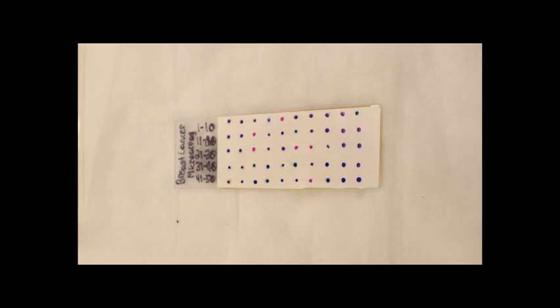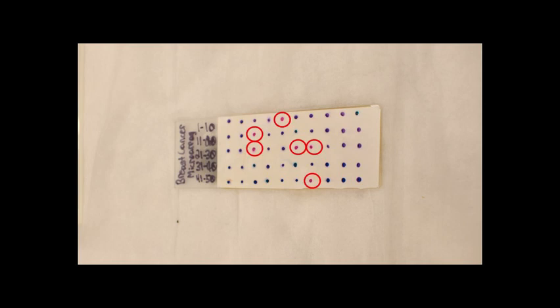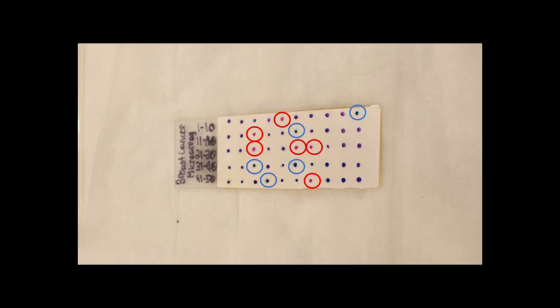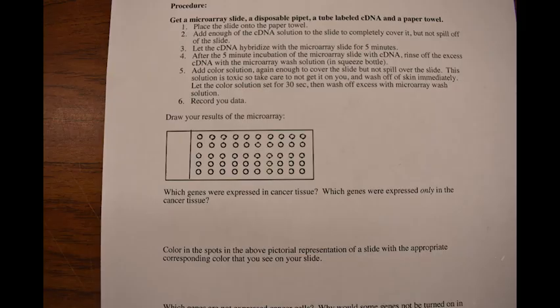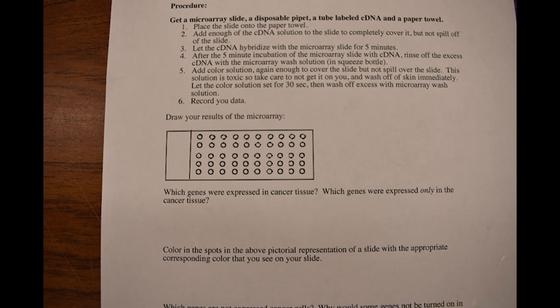As you can see, there are 6 genes which are red and therefore upregulated in breast cancer tissues, and 5 genes which are blue and therefore downregulated in breast cancer tissues. The purple spots indicate that genes are expressed in both normal and breast cancer tissues. You can fill in the colors of each spot on the worksheet. In practice, the colors will fade, so it is recommended that when you are doing this in person, you fill in the red and blue spots first and then fill in the purple spots.